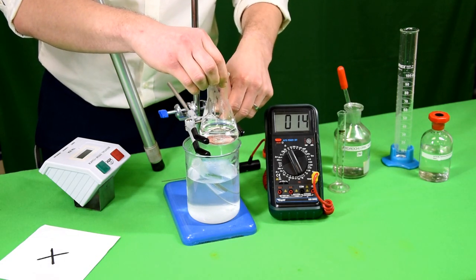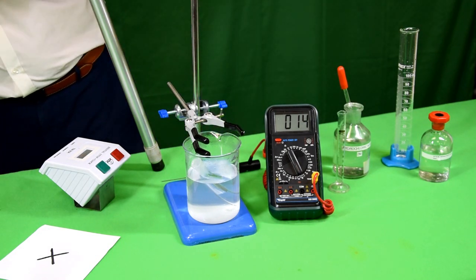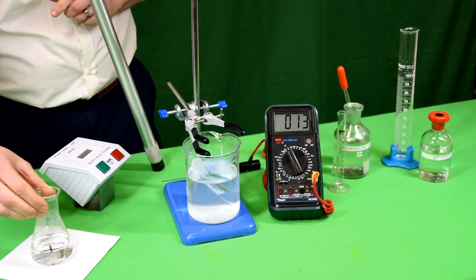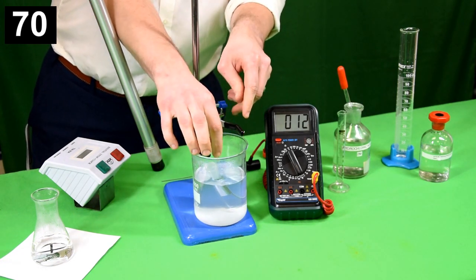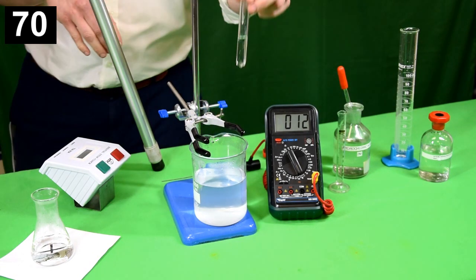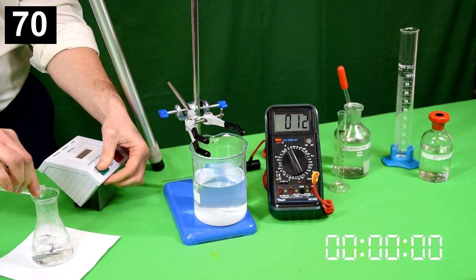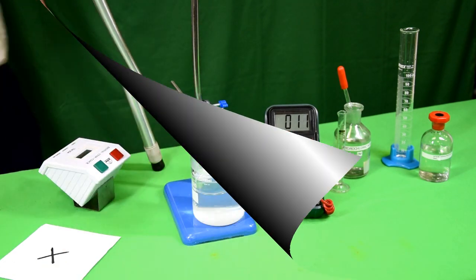A black cross is drawn on a sheet of paper and placed under the conical flask. As the reaction proceeds, the sulphur formed obscures the cross, and once the cross is obscured you stop the stopwatch. Mixing the two together and starting the stopwatch — the cross almost instantly disappears, and you stop the stopwatch.